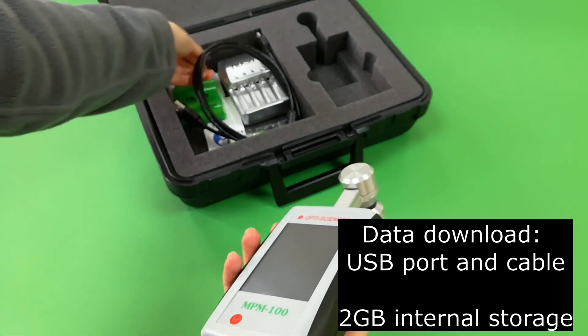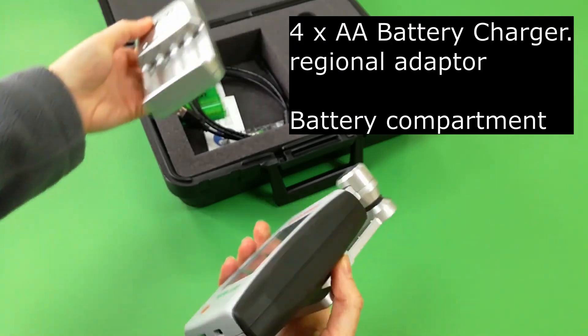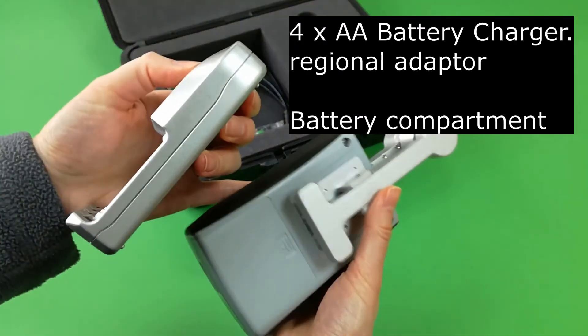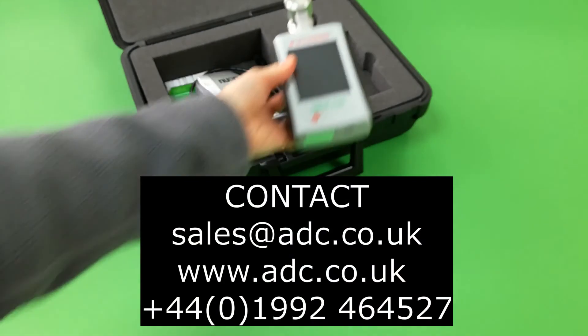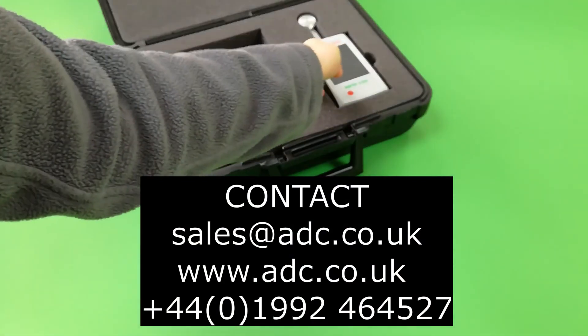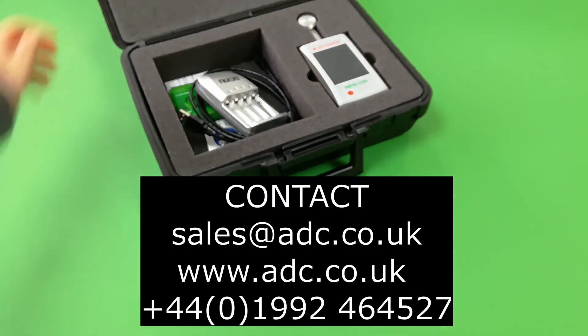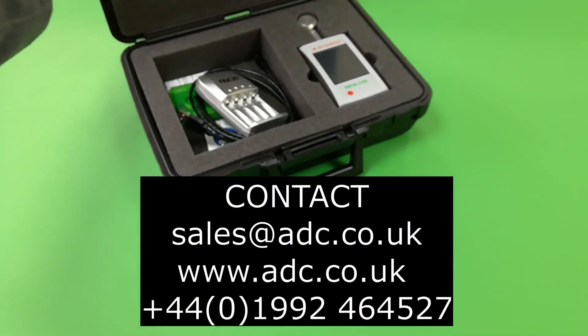Batteries are fitted below the leaf clip. Contact your local ADC Bioscientific Support Centre for more information.